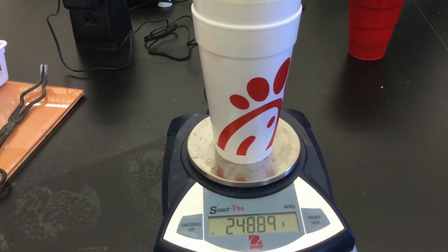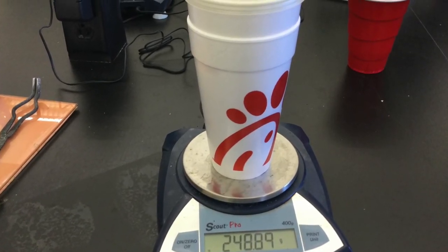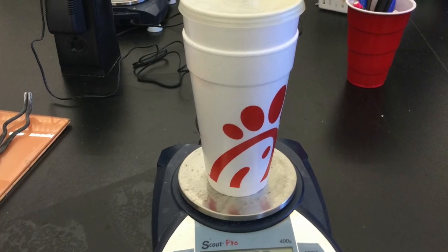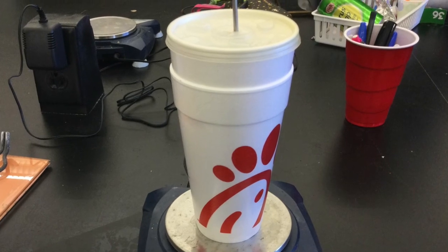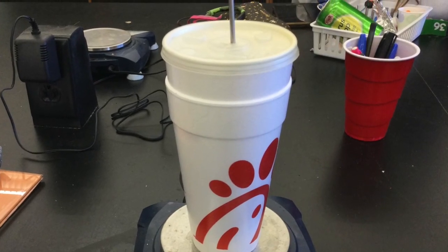Once again, take the mass of the calorimeter with its thermometer and lid and the complete solution. The difference between this mass and the last mass is the mass of your sodium hydroxide. Now you're ready for some calculations.